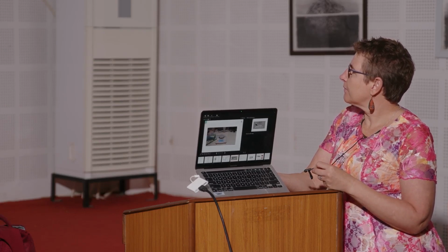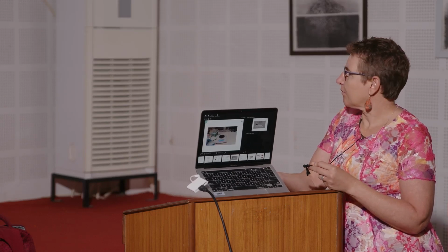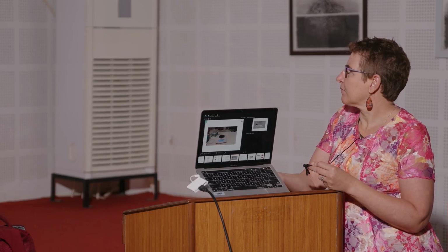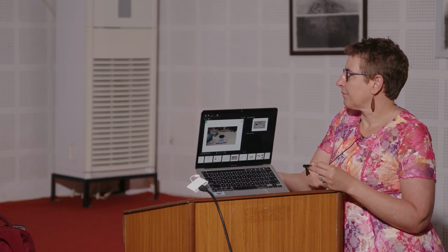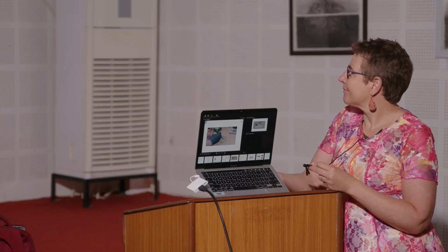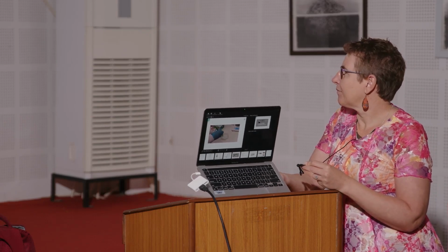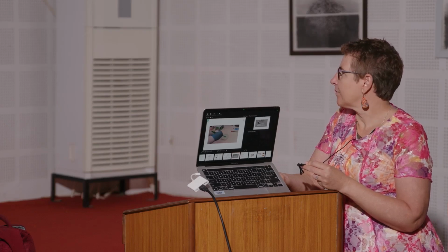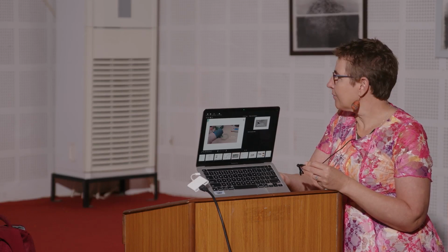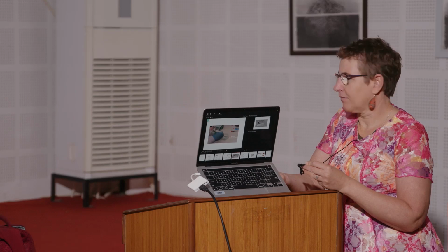Alright, so then the next step, we've got our PDMS base and curing agent. So I'm going to take this off the balance and then mix. Now we're going to mix our base and curing agent together. So mix somewhat rigorously, but also for at least a minute or two. Basically, the goal is to make sure that these 2 components are mixed very well, otherwise we'll have problems later in our manufacturing. It's very viscous, so mixing is hard.